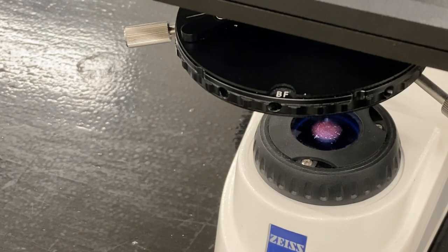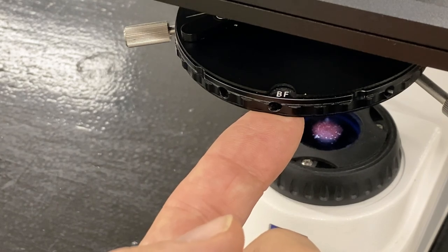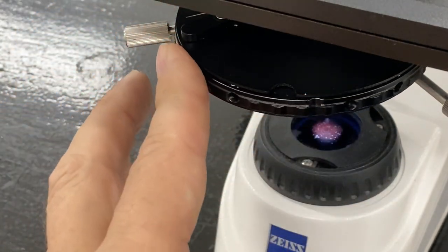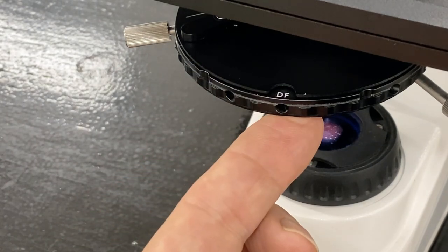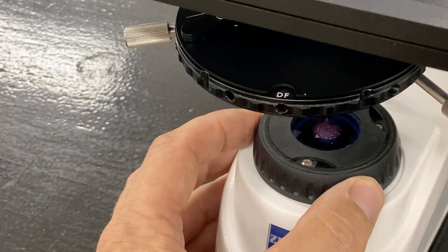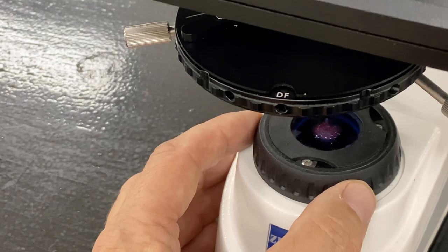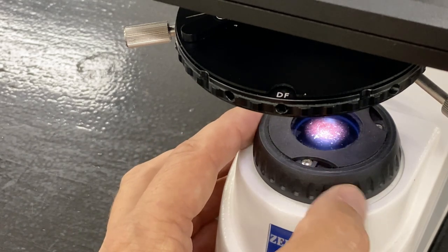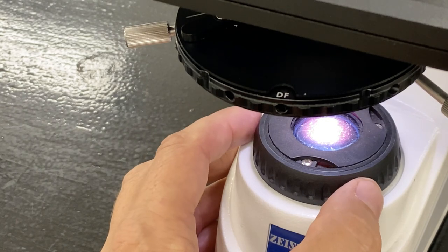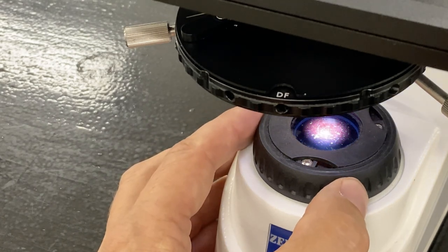I just wanted to show you a quick close up of the turret. Right now it's set up for bright field — BF is for bright field. And if you want to swing the dark field disc that creates a dark background, you just rotate the turret counterclockwise until you see DF for dark field. We can also see our field diaphragm here. If you rotate it to the left or counterclockwise, it closes down the field diaphragm. And if you turn it towards the right or clockwise, you can see that the field diaphragm opens up and it provides more light to the specimen. That's it for today. Next time, we're going to do part B on phase contrast.